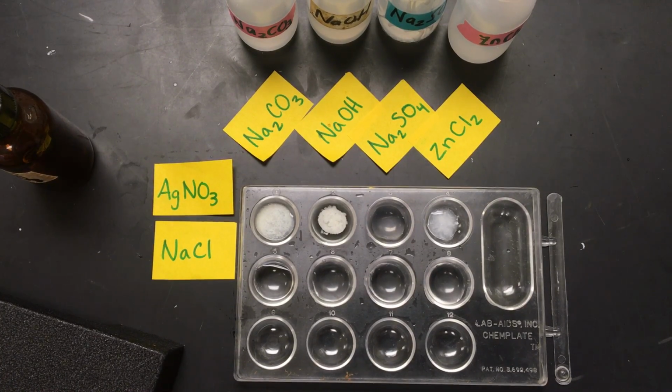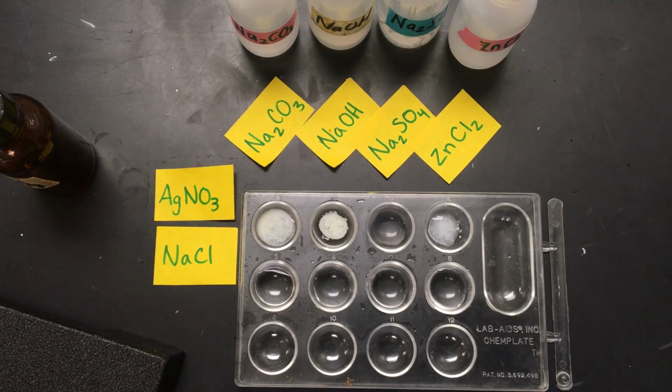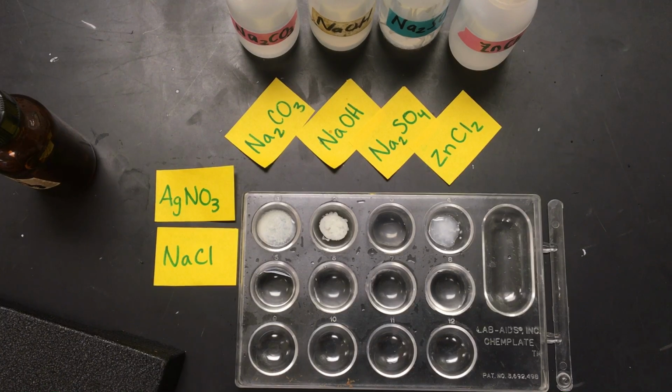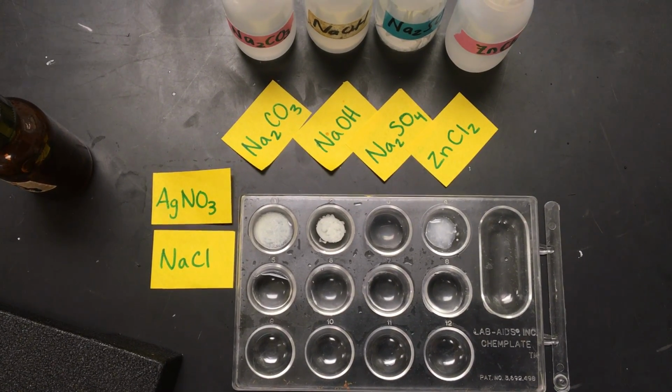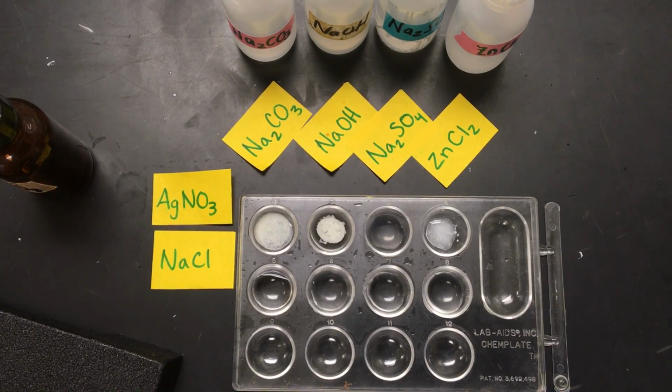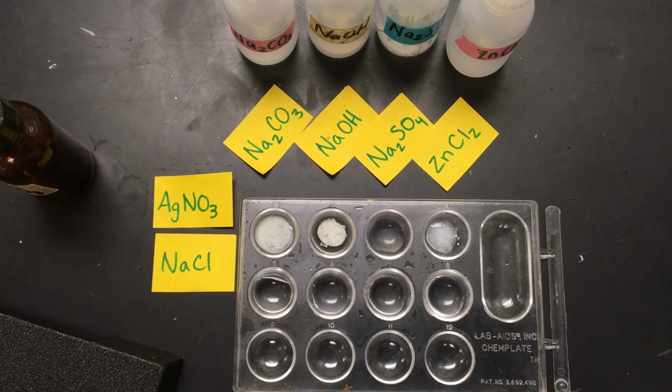So go ahead and write some quick observations of these precipitates that you did see form. Analyze what substances that we saw mixed together tended to form precipitates or tended to not form precipitates. And then your last task is to write 3 net ionic equations for 3 reactions that form precipitates. And I'm pretty sure we're only seeing 3 here.